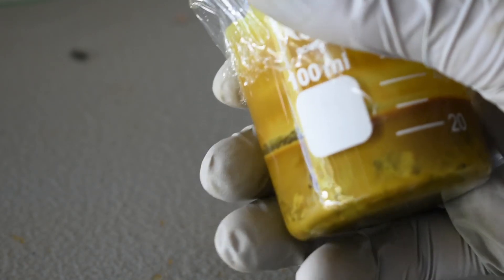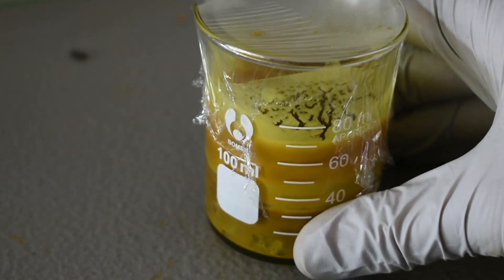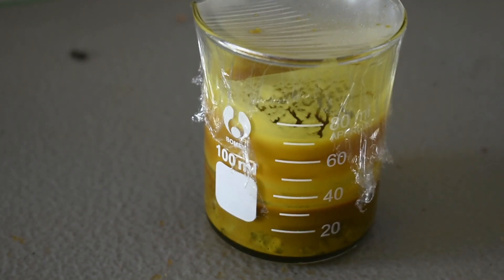It's turned into a thick sludge. All of the pyridine is being absorbed and attaching to the iron. I might have to add more. I think I'll do that now, actually.